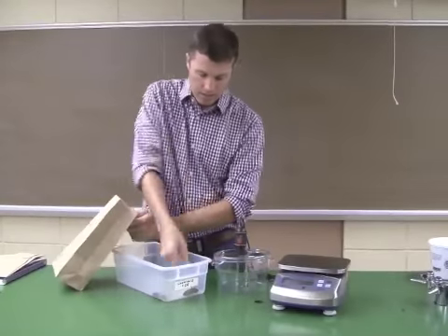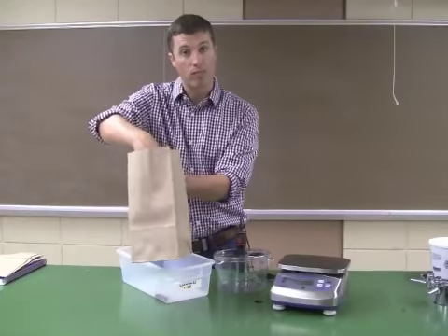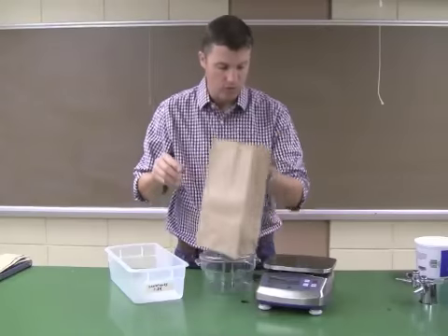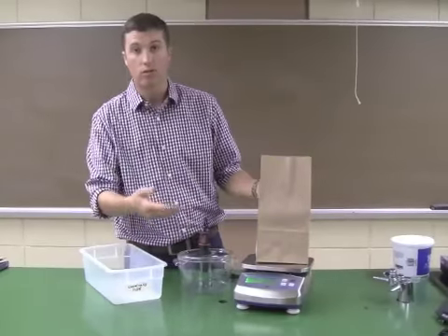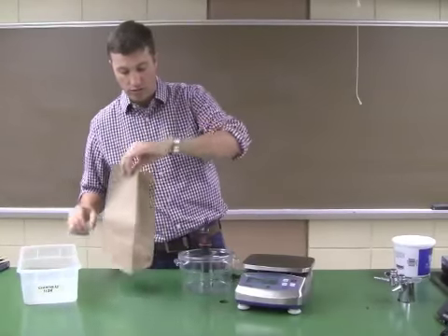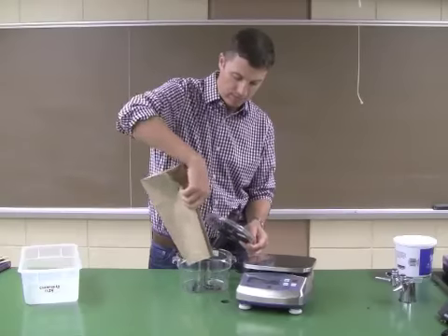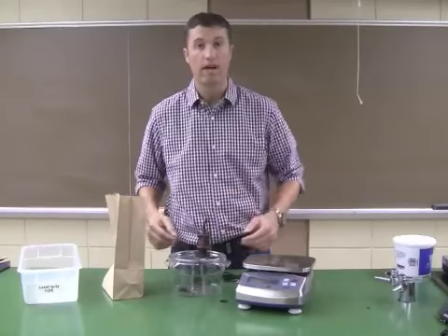So I'll pick up my cockroach here, and I'm going to put it into my scientifically, technologically advanced weighing sack, and I'm going to weigh my cockroaches and look at the weight, record the weight in your lab manual, and then I'm going to transfer the animal from the sack into the respiration chamber, and you can just pour them right out like that into the chamber. Now you're ready to go.